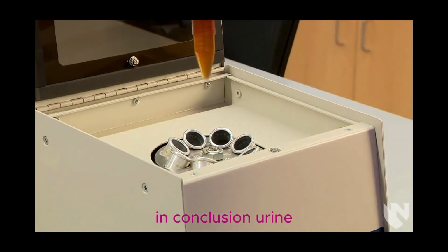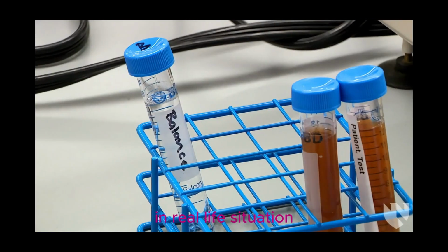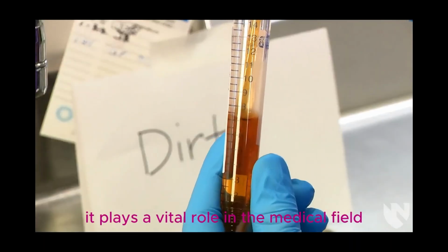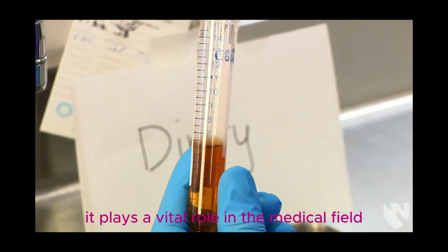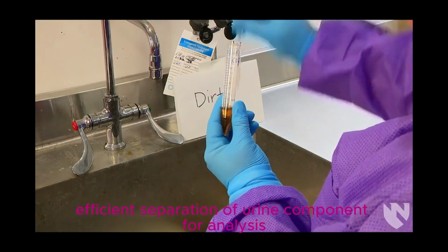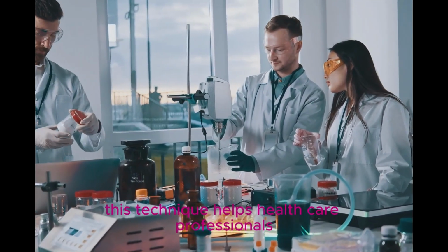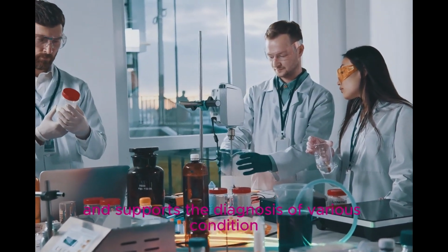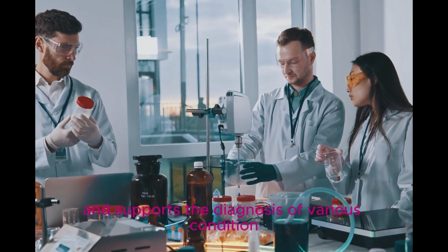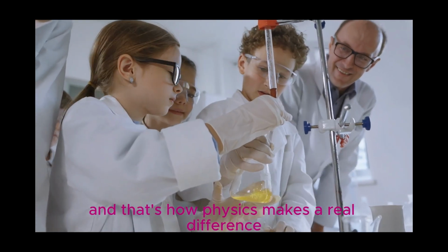In conclusion, urine centrifugation is an important application of physics in real-life situations. It plays a vital role in the medical field by allowing efficient separation of urine components for analysis. This technique helps healthcare professionals obtain accurate results and supports the diagnosis of various conditions. And that's how physics makes a real difference in our life.